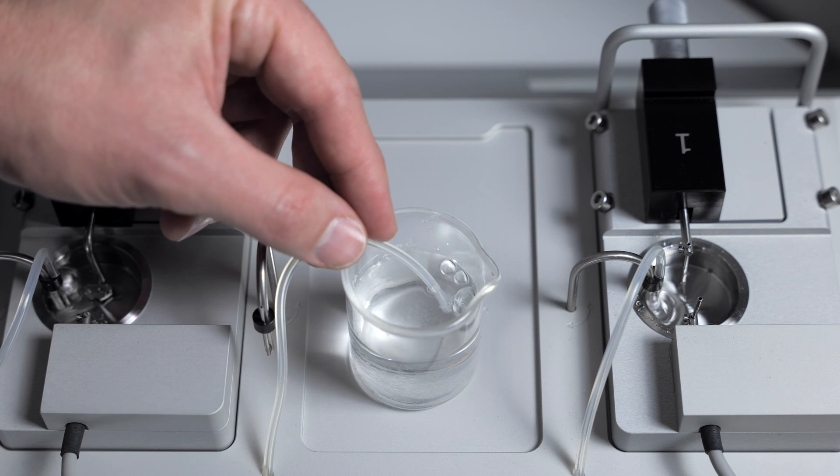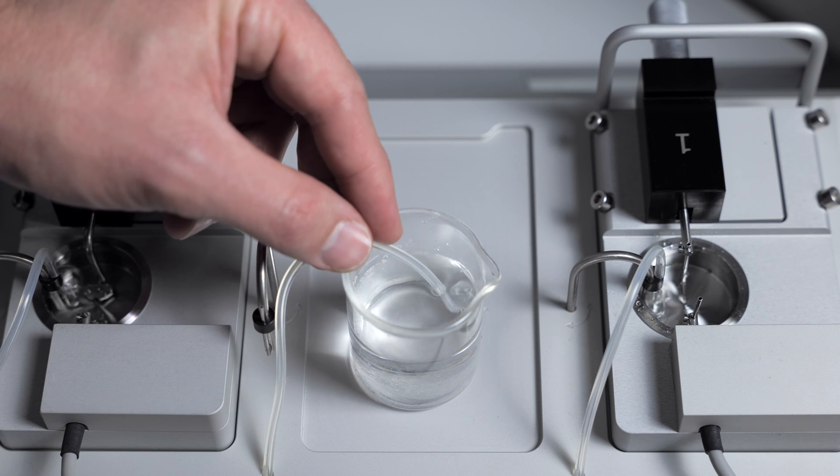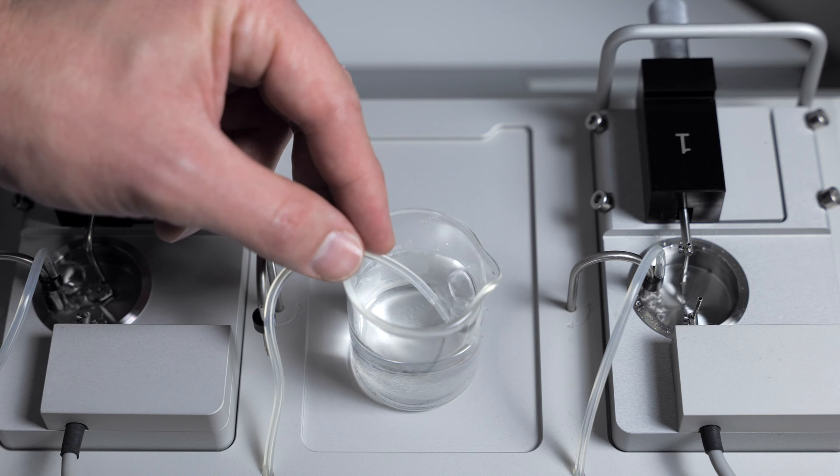If there's still no bubbling, then the internal tubing is clogged, and you will need to send it to DMT for repair.